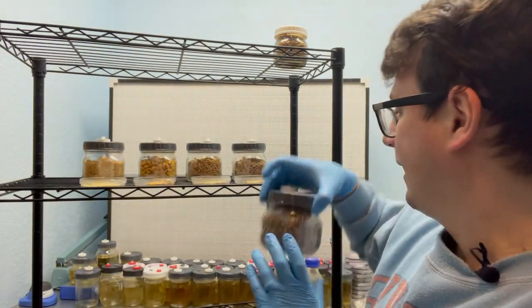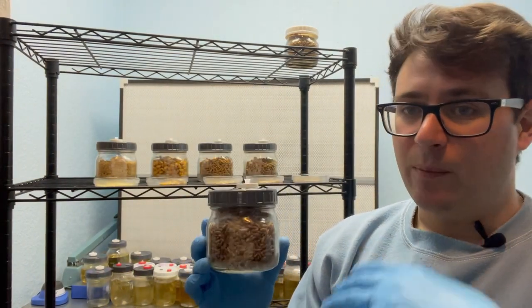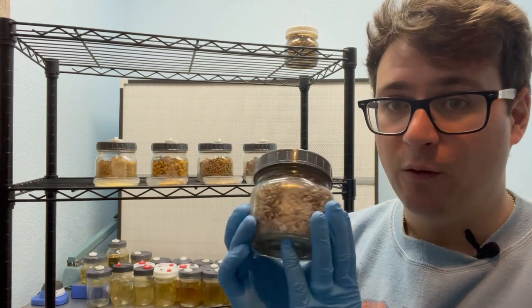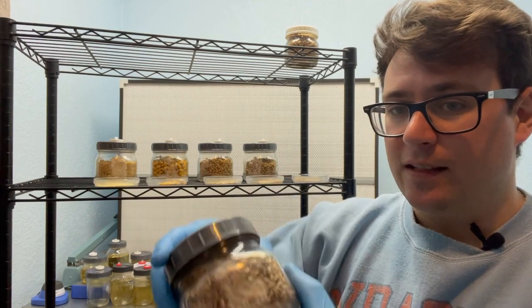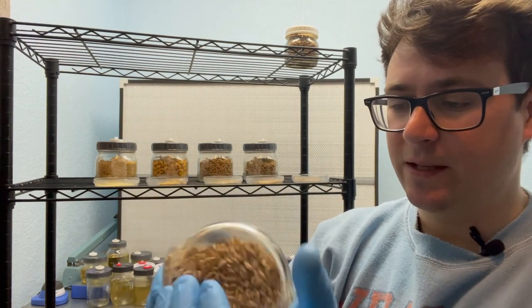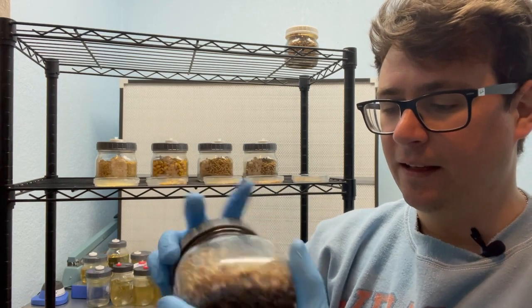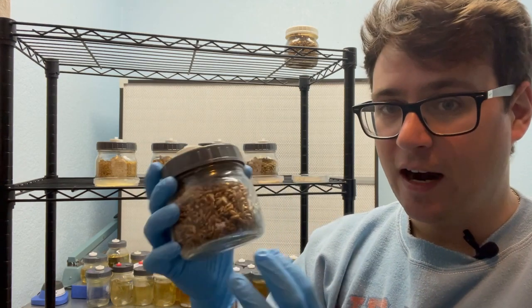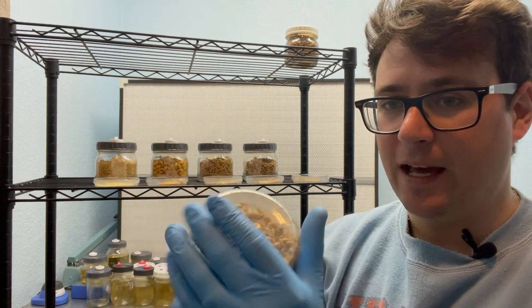Now that we've gone through our observations I'm going to shake up these jars and then I'll put them back into incubation for about five or six more days before we move into bulk substrate. One tip is that you can use a tire or something if you're concerned about breaking the jar. What I do is I'll just look for some cracks and honestly I'm not even shaking them that hard.